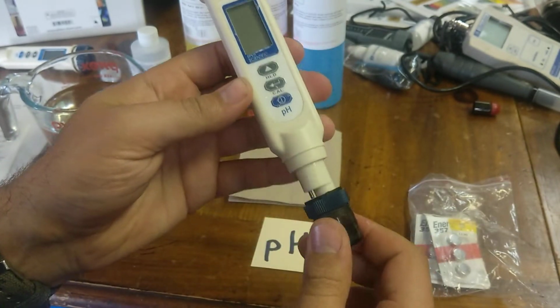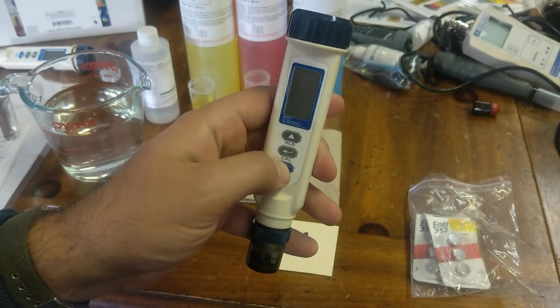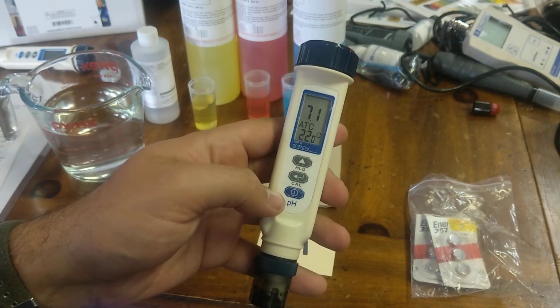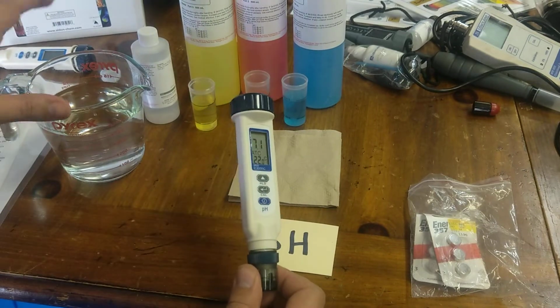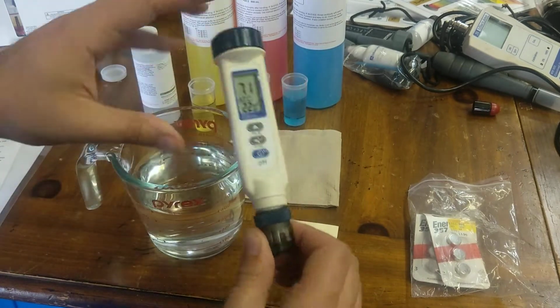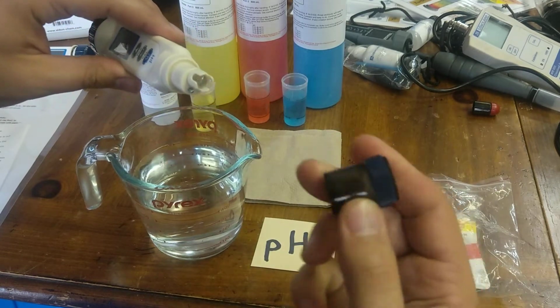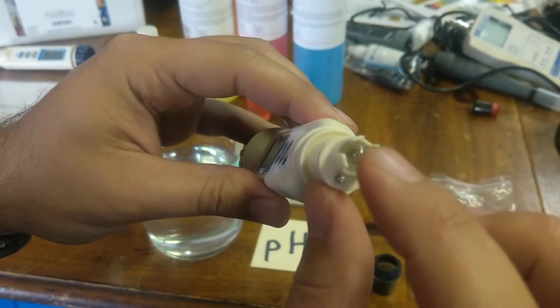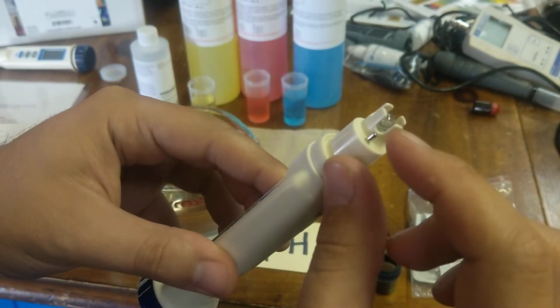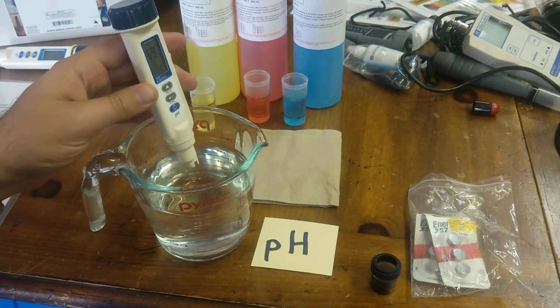At this point, there should be a cap on here that goes on like so. Press the on-off button here, and it should go on. For everyday sampling, you get a sample. You can open the cap like this. Make sure you don't lose the cap. And what you'll want to do is do not touch this bulb. This bulb is very sensitive and will break if it's knocked against rocks and things like that.